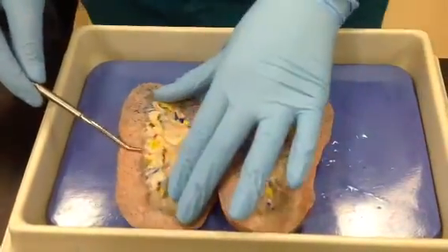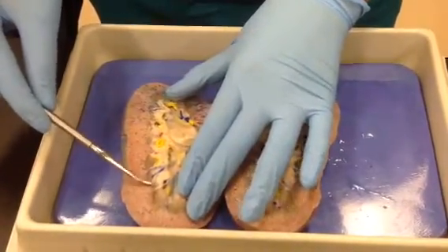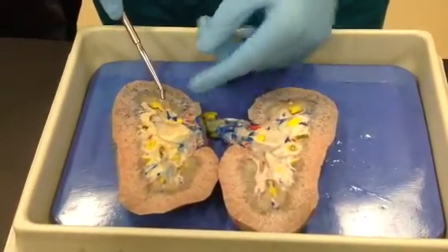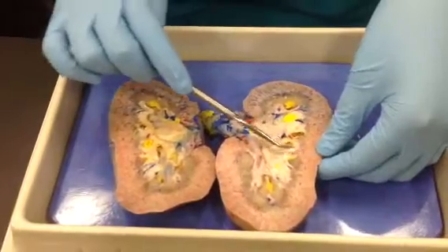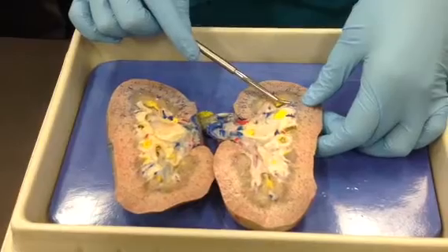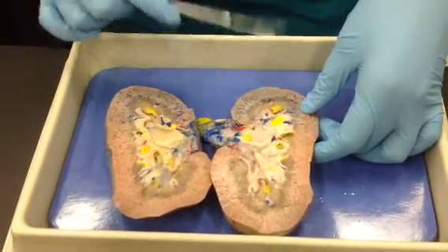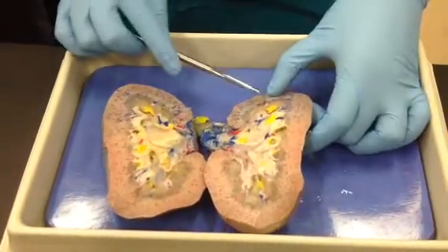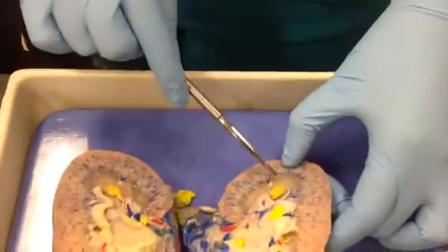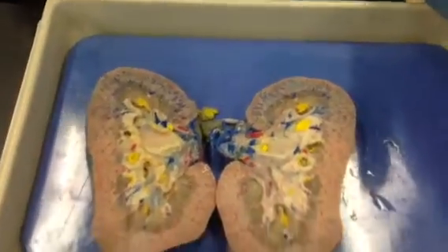In between the pyramids, you can see, in this case, this is a small renal column. This would be another renal column. This would be a renal column, and here would be a renal column. And also over here would be a renal column. Here you can see an interlobar vein, and again, once it comes behind to the base of the pyramid, it would now be called an arcuate vein. And this is actually an arcuate artery shown here, that small artery right there, which they left intact. That's an arcuate artery. So yeah, that's pretty much what you need to know.